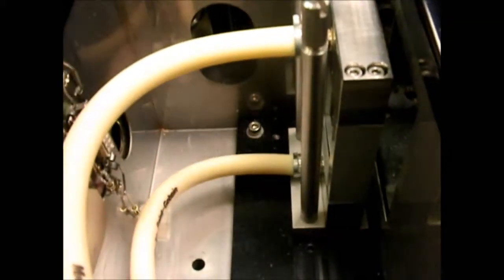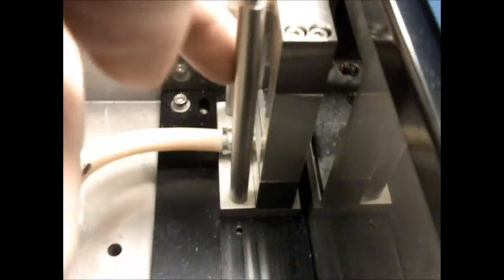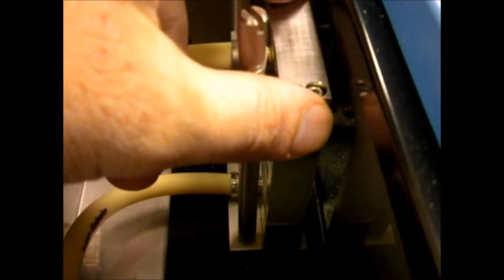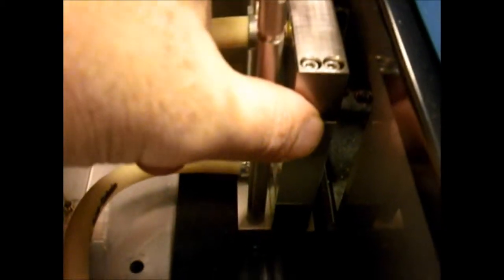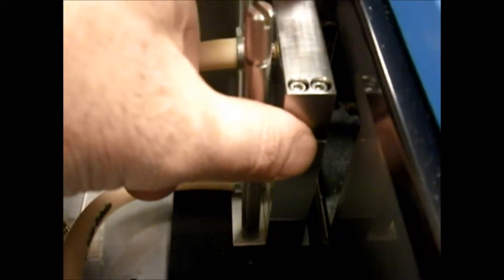When the instrument first arrives in Fredericksburg, the sample cell will be removed. The sample cell is located right here. Simply loosen these screws, put the sample cell in here, and re-tighten.